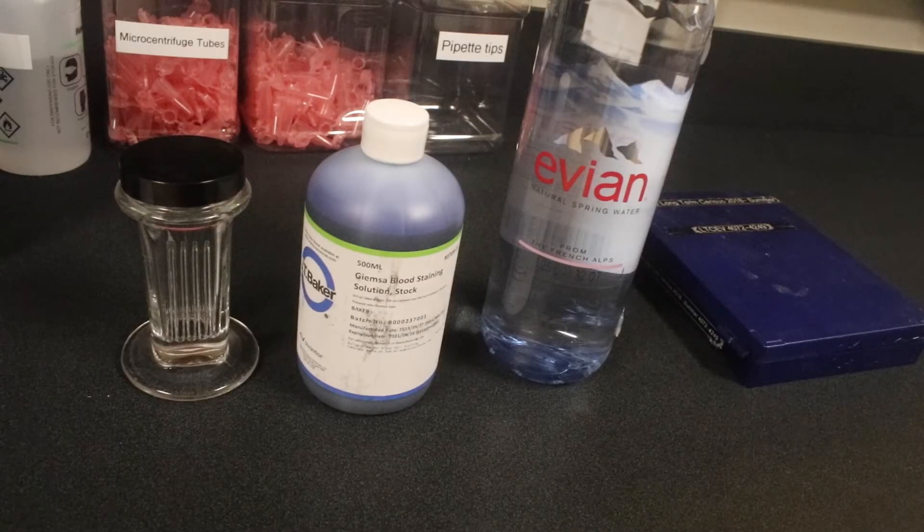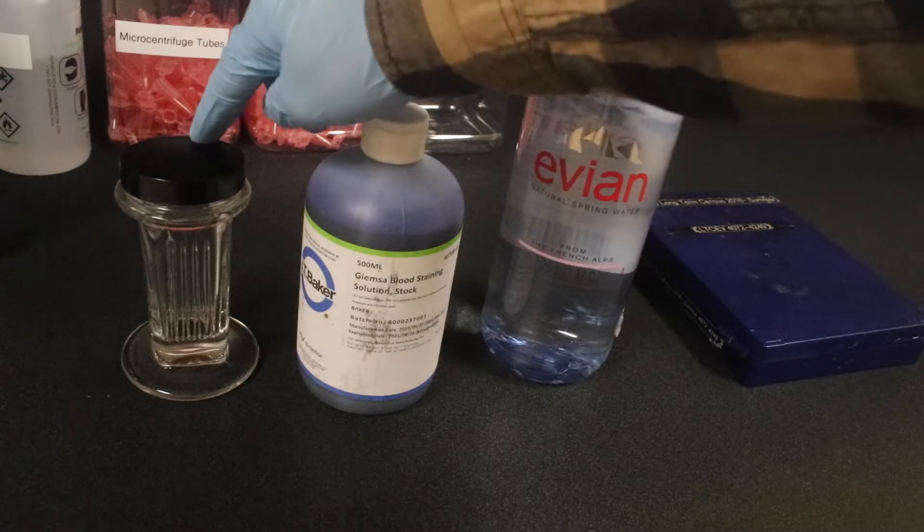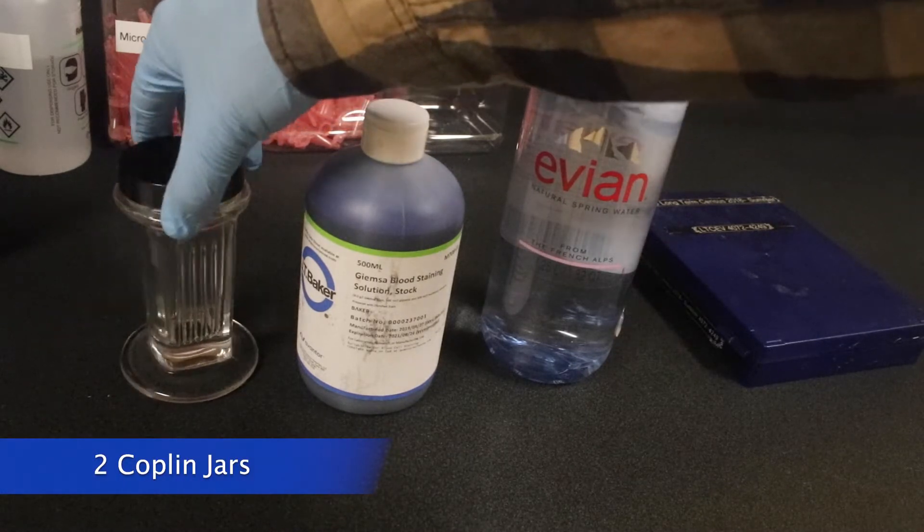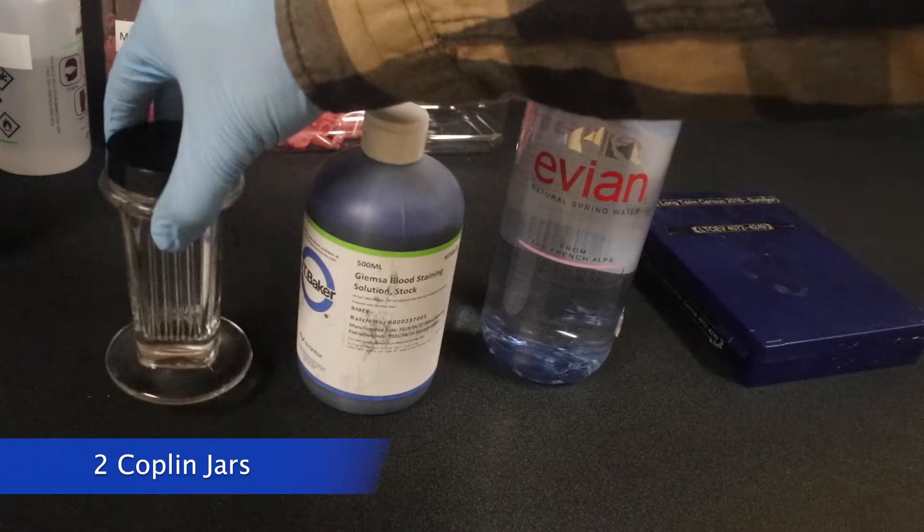First things first, let's identify our items. We'll need a Coplin jar, and we're actually going to need two of these.